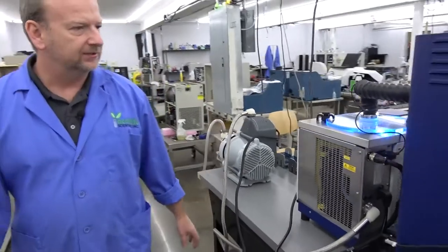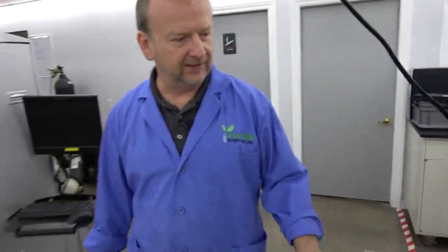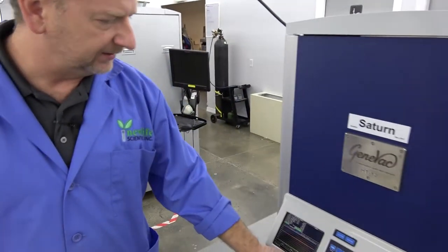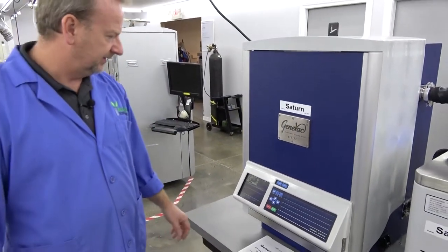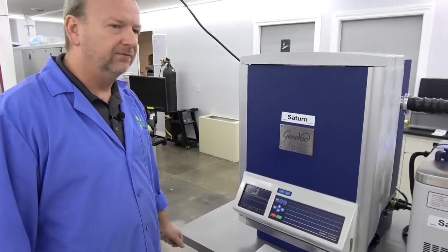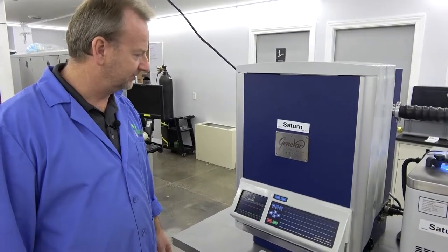But we're going to power it down so we can get a shot of the inside of the chamber. And it's going to wind down a little bit. So I'm going to go ahead and just stop it. And we'll take a few minutes here. We'll be back and show you the inside.